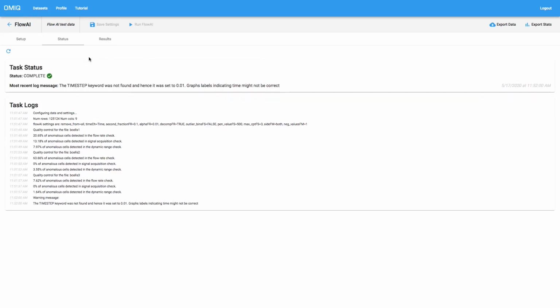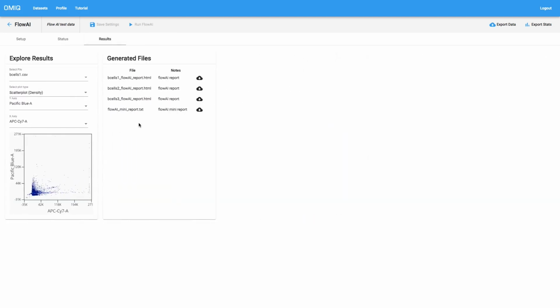When Flow AI is processing, it will put out logs just like any other algorithm will. Upon its completion, we can review these logs if we haven't already, to make sure no errors or anything like that happened. And then we can turn our attention to the results. Now, the results for Flow AI are two separate major components.